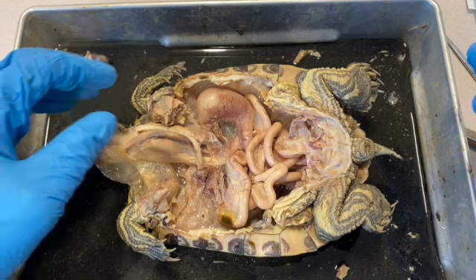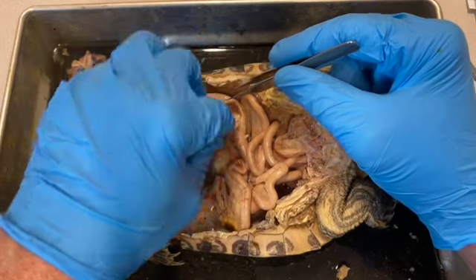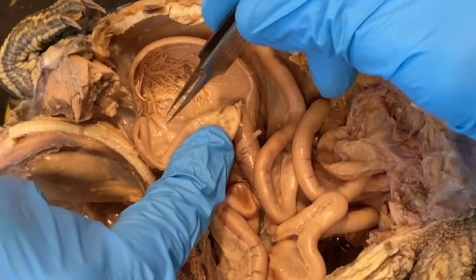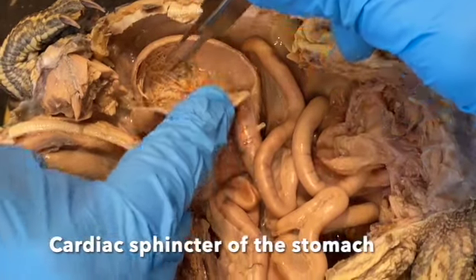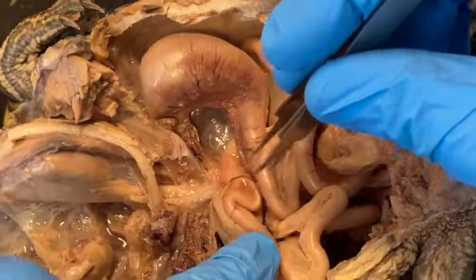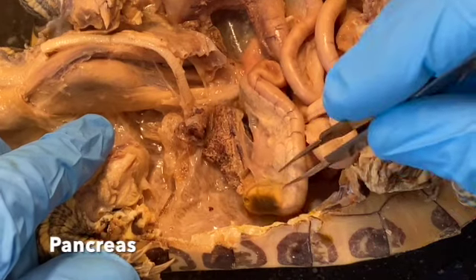Okay, so the next thing I want to show you is the stomach. And I've opened the stomach, and this is what was inside. But if you look up here where you see these folds, this is where the esophagus joins the stomach. The stomach is kind of a J-shaped organ, this large storage area, and it turns the corner and comes up here past the area where the pancreas is located.